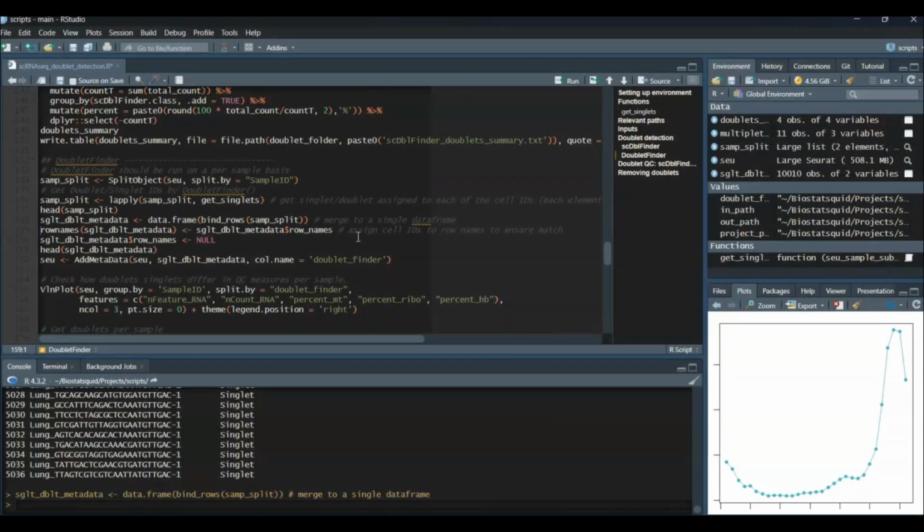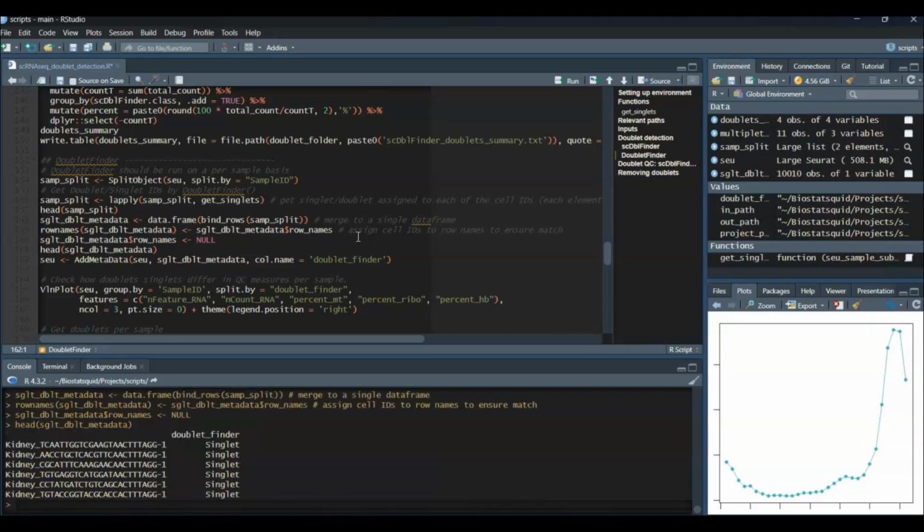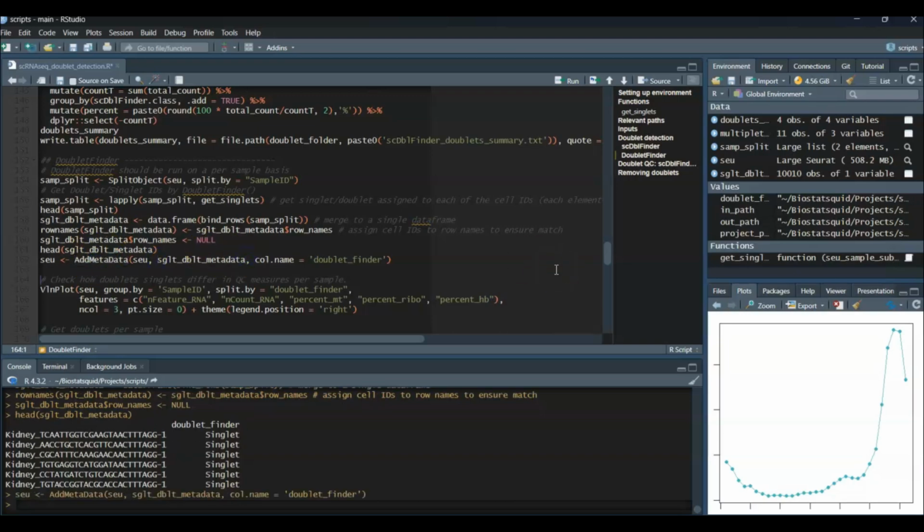Cool. So now we bind them all into a single data frame, and we set the row names to the actual row names of the data frame. So now if we have a look, we should get something like that. So just one data frame with all the cell IDs and then the DoubletFinder results or labels. Cool. So now we can actually add them to the original Seurat object with AddMetaData.